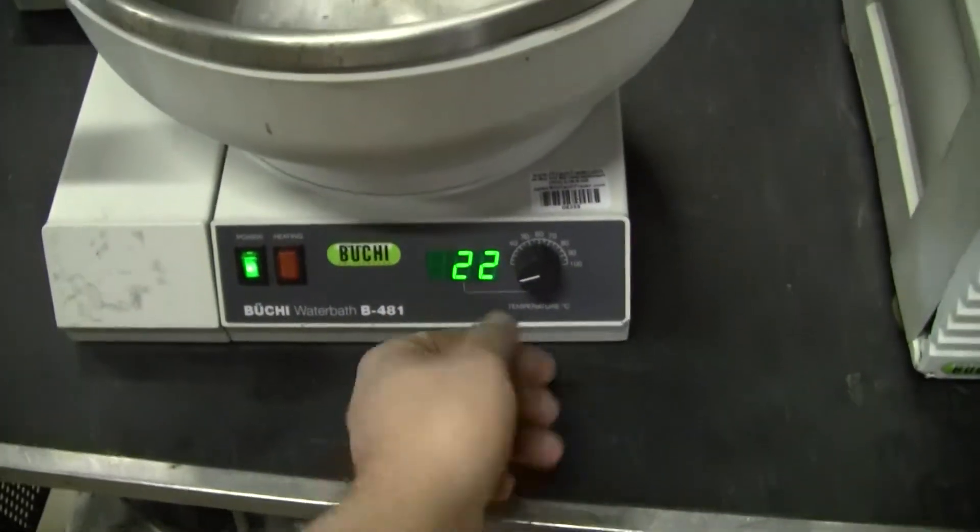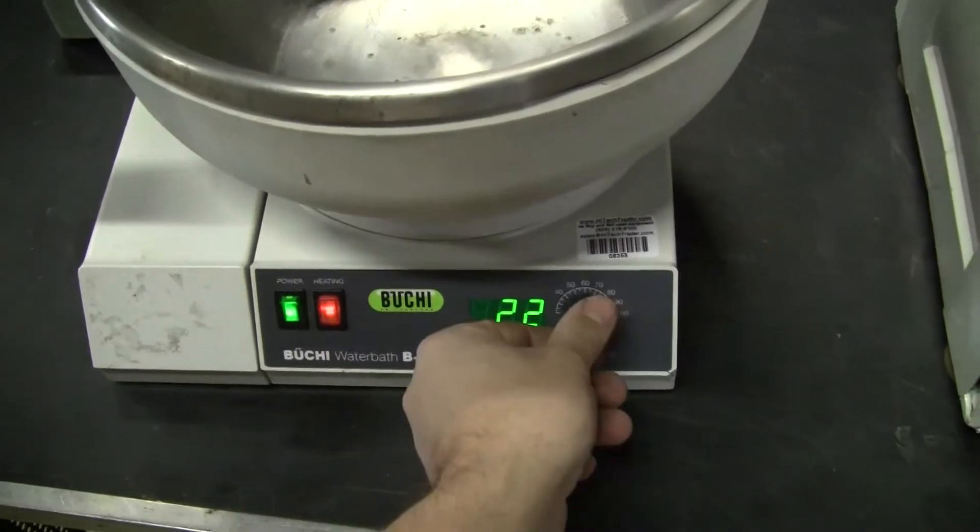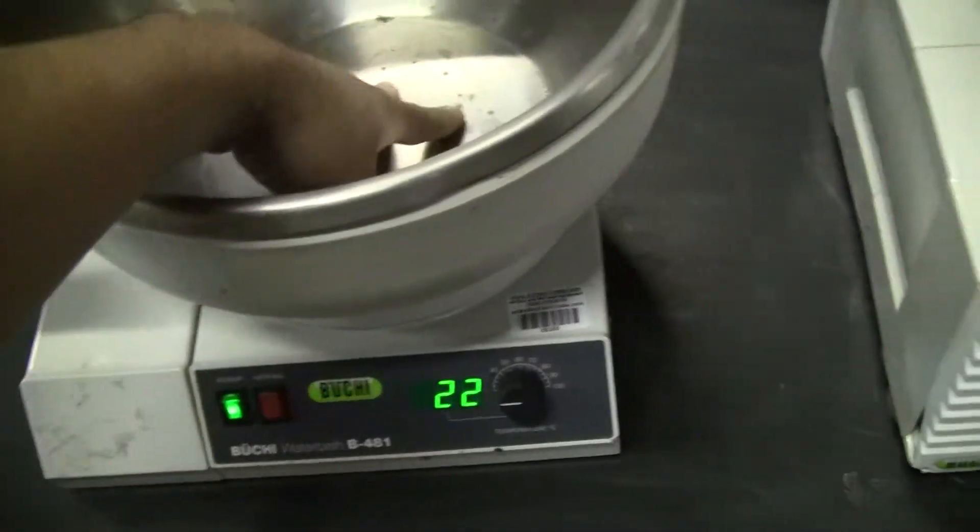Your temperature bath - you can set it here. Turn it on, you see the heating light. It does get hot. Vacuum pump.